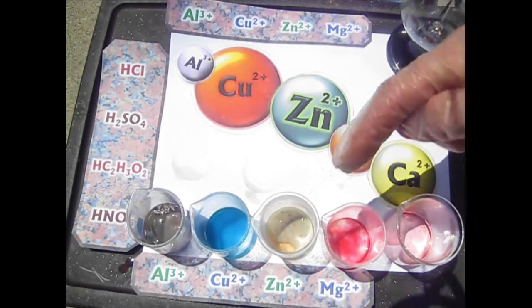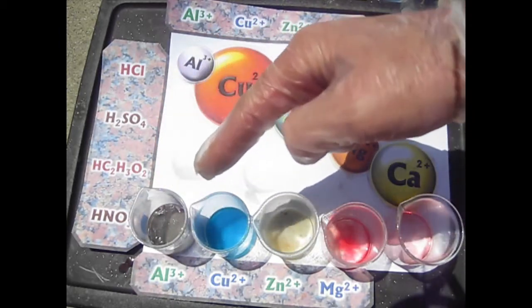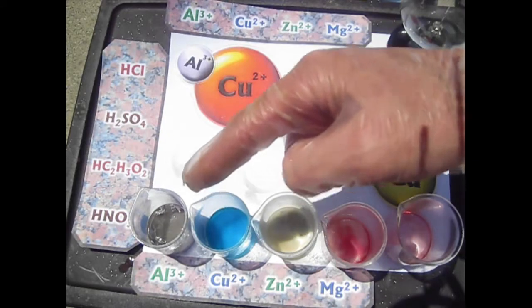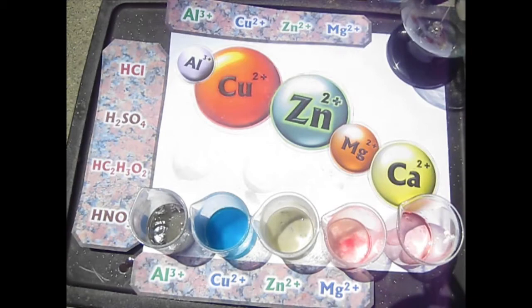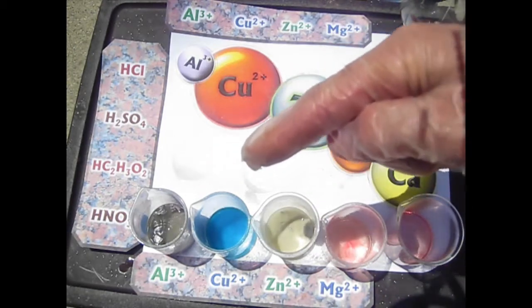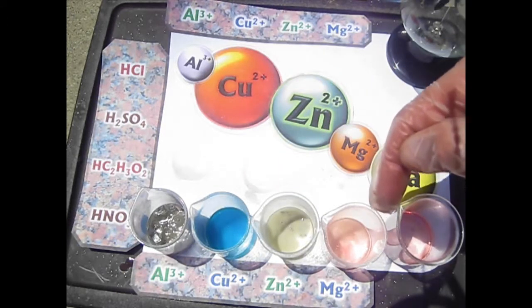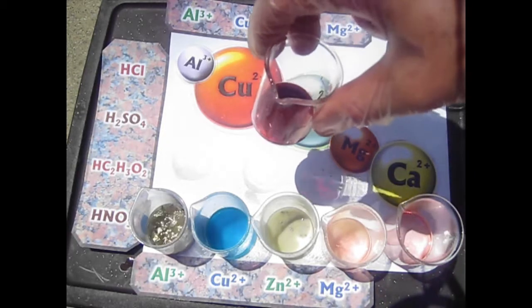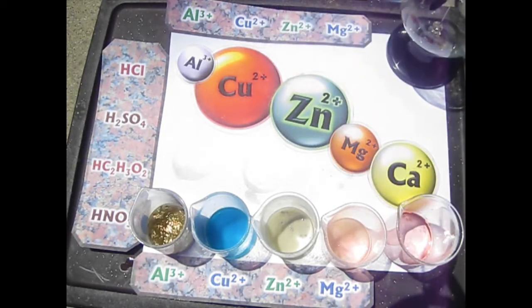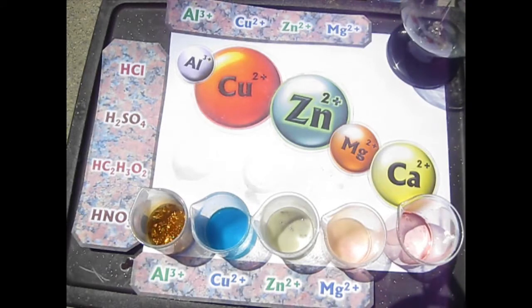So we still see a little bit going on here. Oh, this reaction finally seems to be getting going. It could be because the aluminum had an oxide layer around it. It might have taken this long to break through that oxide layer. So maybe even though aluminum is pretty high up on the activity series, it's really just below magnesium. It's actually above iron and even above zinc. Okay, so maybe it's taking this long to get going. There we go. Finally, let me get my other camera ready.